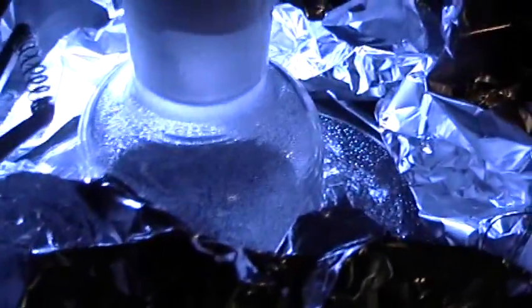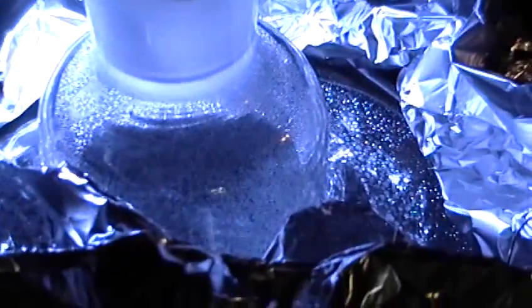If you look closely — I don't know if it's going to come out in the video — but there are small beads of mercury forming. It looks cloudy probably in the image you're seeing, but those are very, very small beads of mercury condensing on the flask.